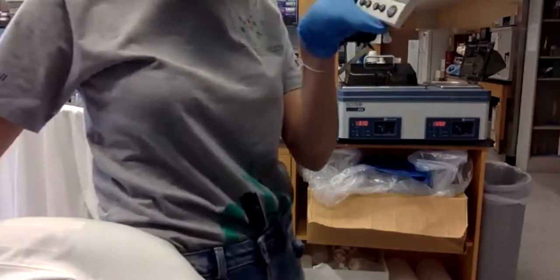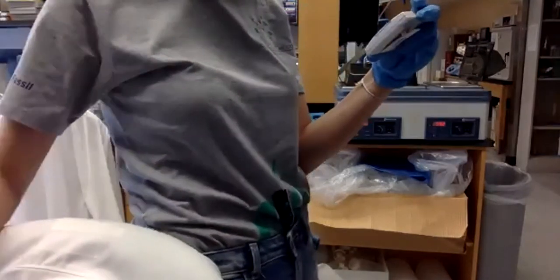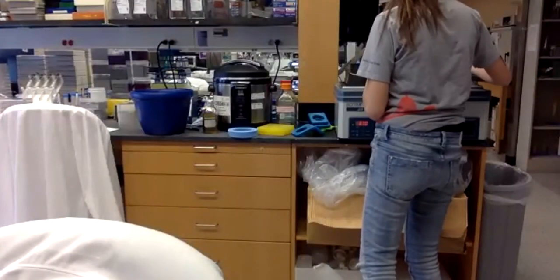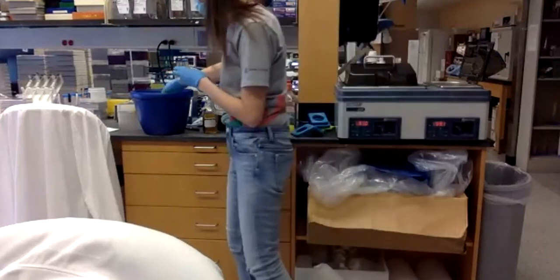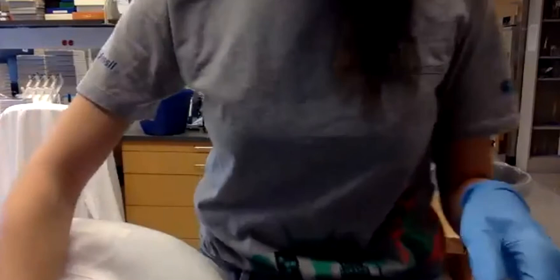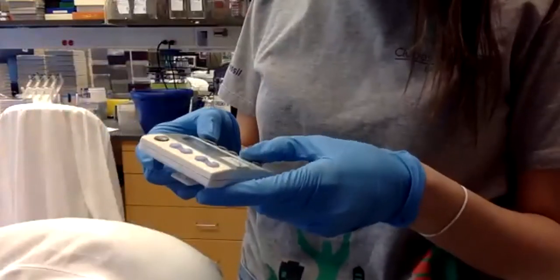Six, 5, 4, 3, 2, 1. Okay, now I put it in ice for 2 minutes.